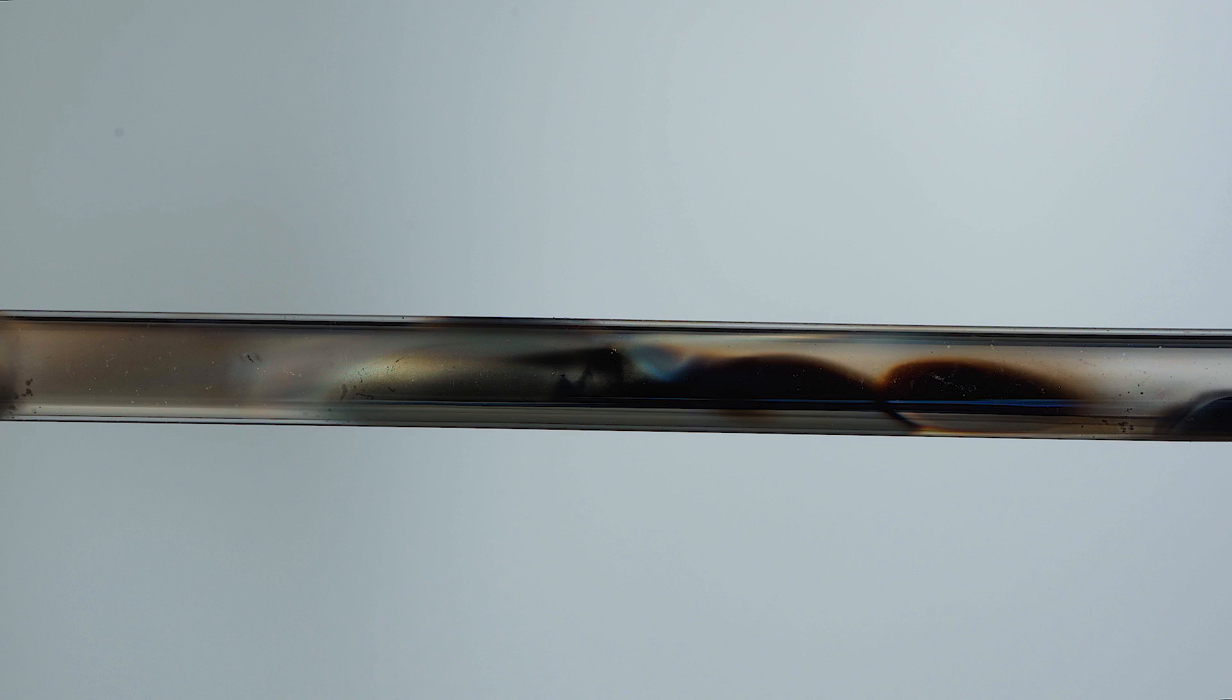Note that the amount of germanium that settles down on the tube walls is the greatest in the areas where the gas torch contacted the tube.